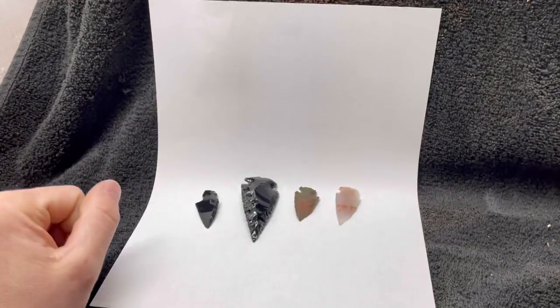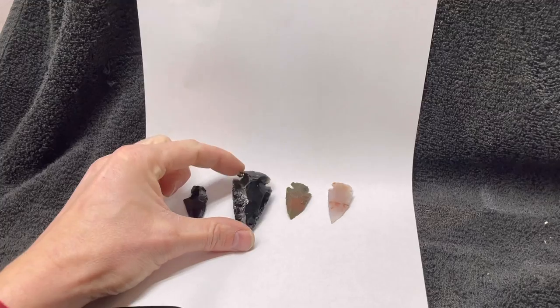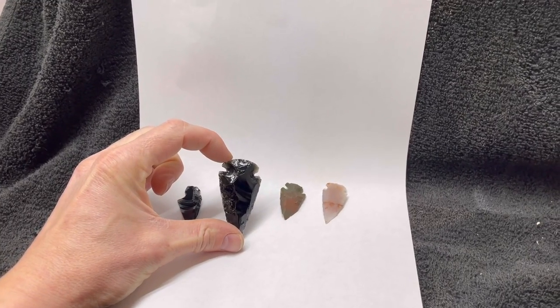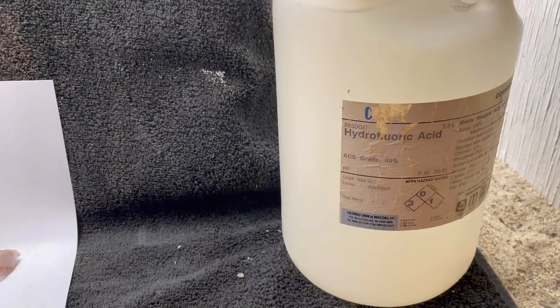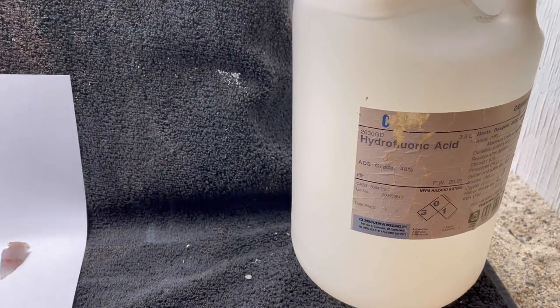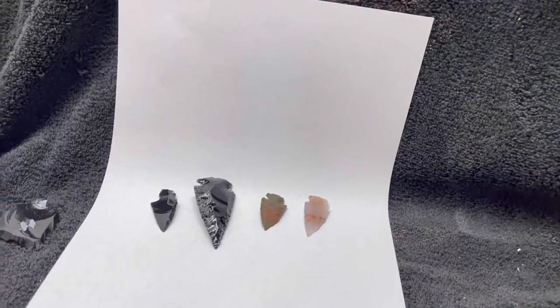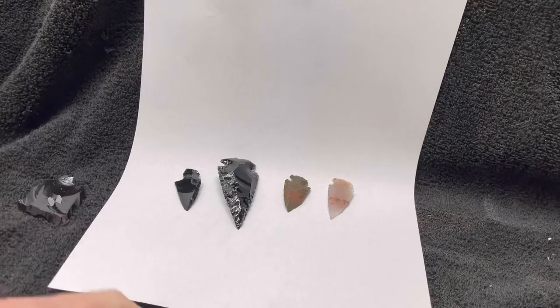Welcome back to Cody's Lab. So today I have some arrowheads. I've always wanted to see what happens if I put these in hydrofluoric acid. This is the scary stuff that dissolves glass. These are a glass-like material, so it should dissolve them.